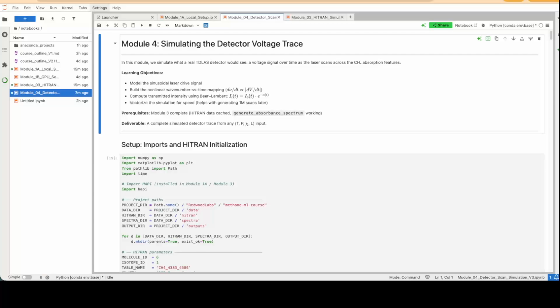Okay, here we are on the fourth module. In this module, we simulate what the response would be on the detector. This is a scan direct absorption technique where we scan over a small wavelength range, wave number range, across the features that we're targeting. For every period, we have an upscan and downscan, so we're able to trace out the absorbance for a very tiny, approximately one nanometer range in wavelength space.